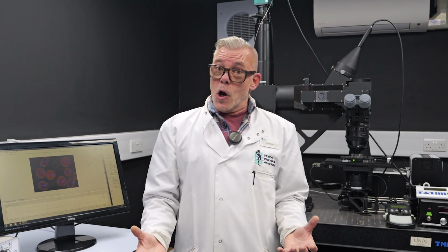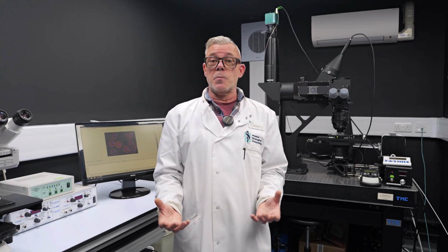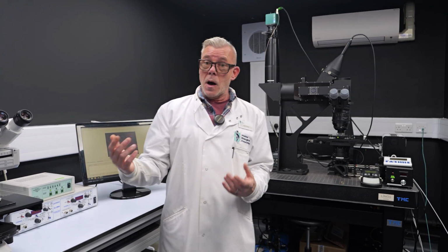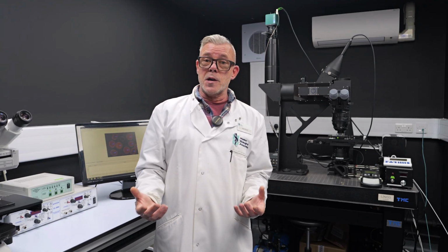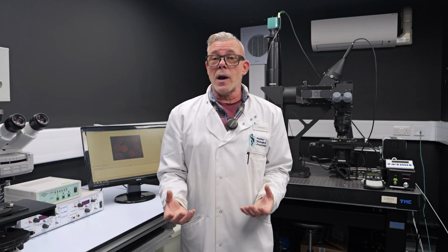So because of this global importance, we're interested in understanding how phytoplankton photosynthesize, their rates of photosynthesis, and some of the physical drivers that can impact photosynthetic performance, all of which lead to differences in the amount of carbon that's being fixed by phytoplankton. We can measure photosynthesis in phytoplankton indirectly, simply by imaging and measuring fluorescence produced by chlorophyll.